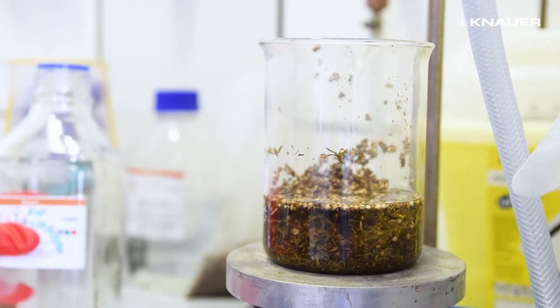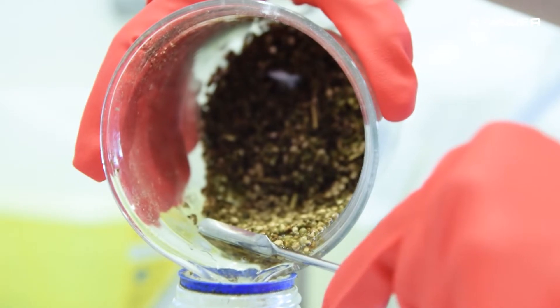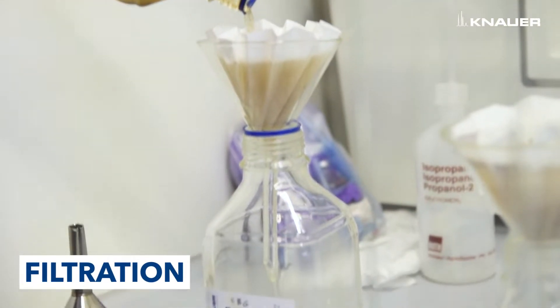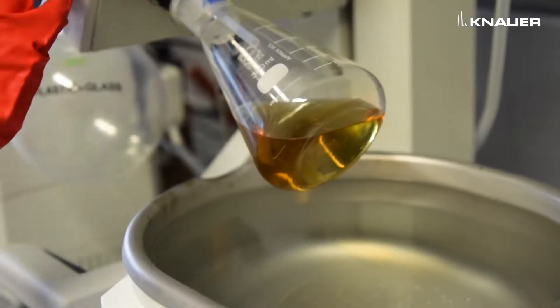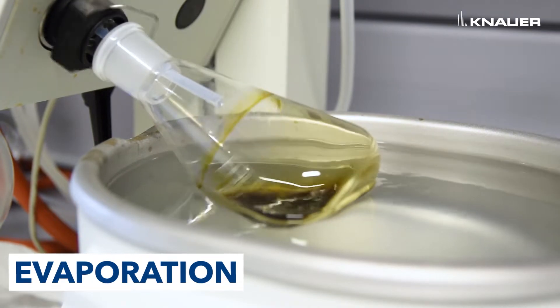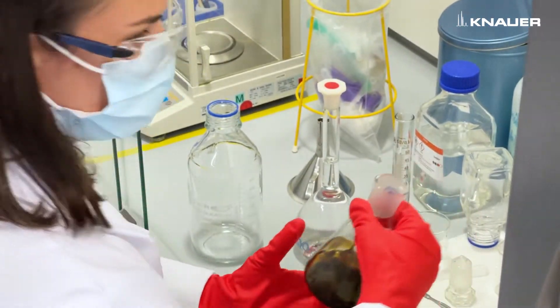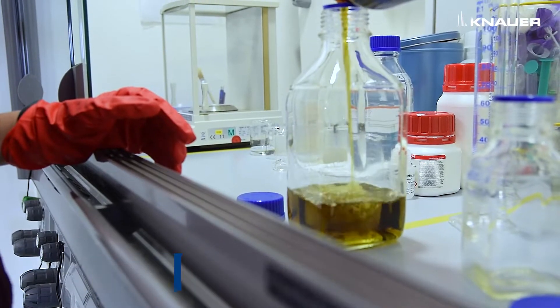Cannabinoid extraction is performed with ethanol. After 15 minutes, ethanol is withdrawn from the plant material and filtered in order to remove solid particles. The sample is then concentrated with a rotary evaporator. The ethanol that has been removed from the sample will be recycled for new extractions.